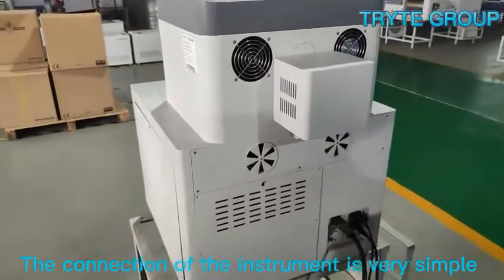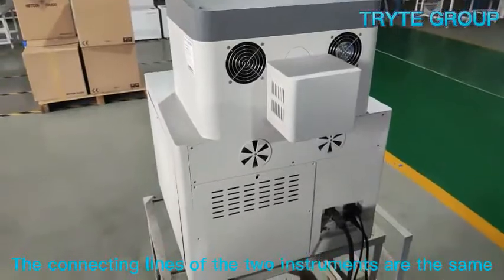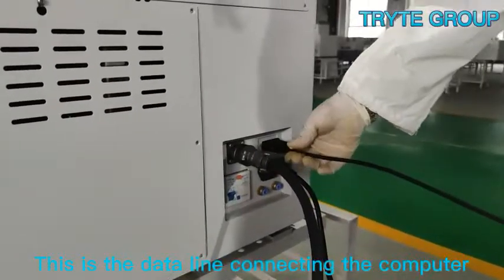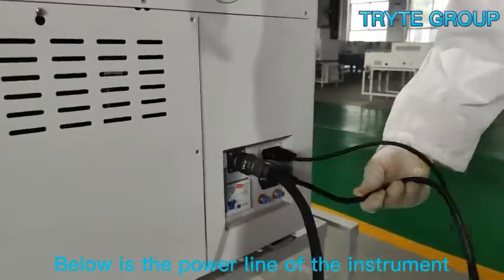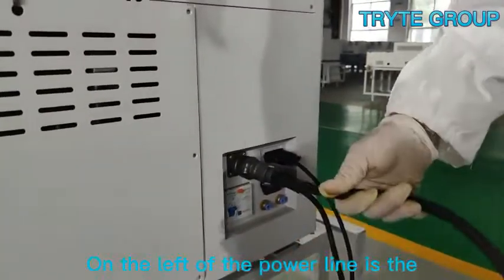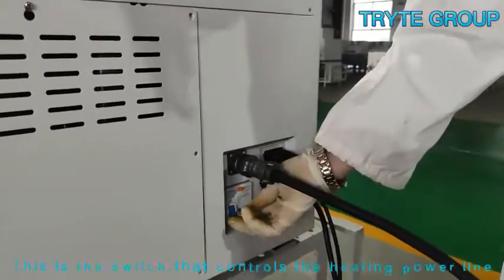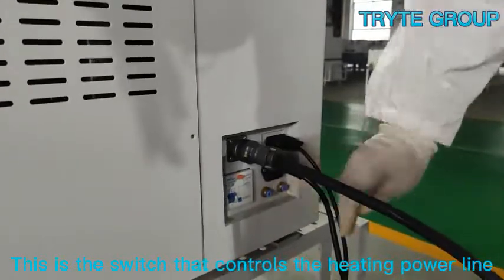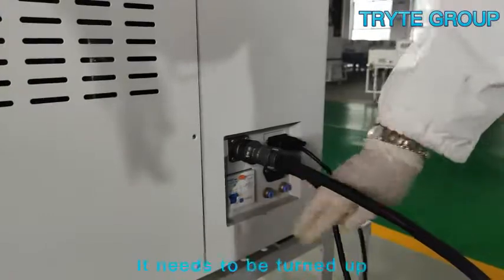The connecting lines of the two instruments are the same. This is the data line connecting to the computer; below is the power line of the instrument. On the left of the power line is the heating power line of the instrument, and this is the switch that controls the heating power line.